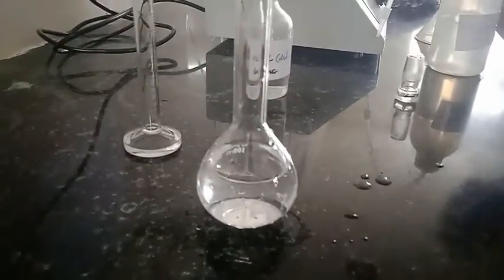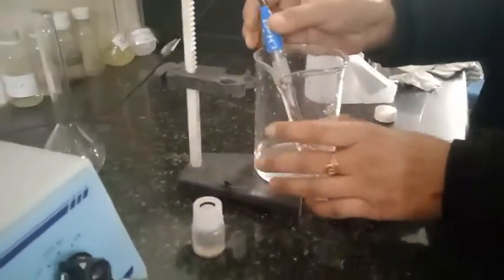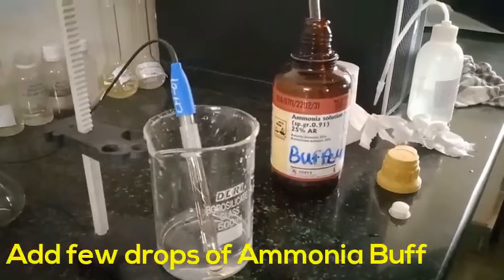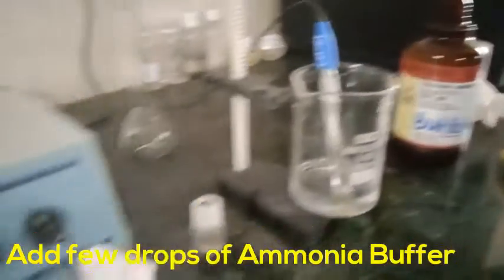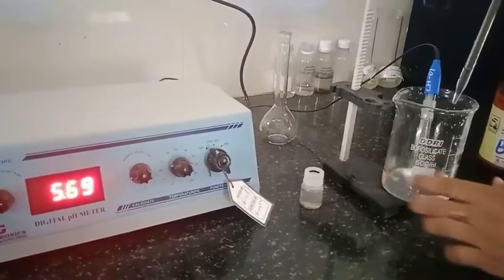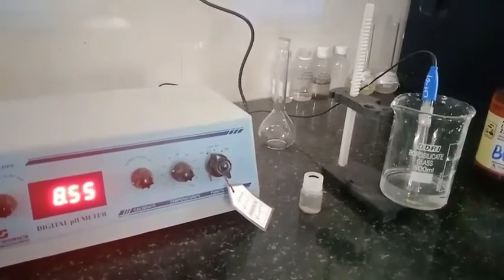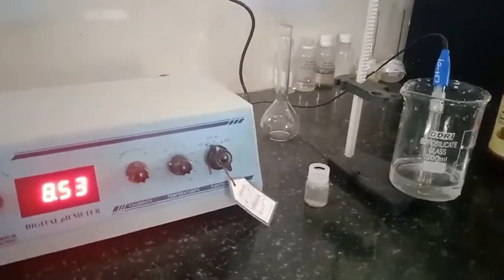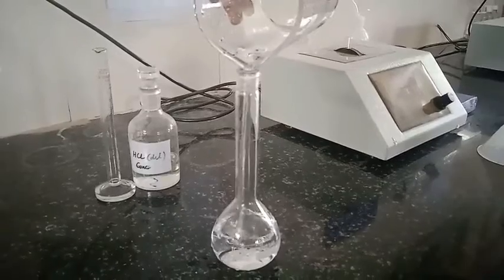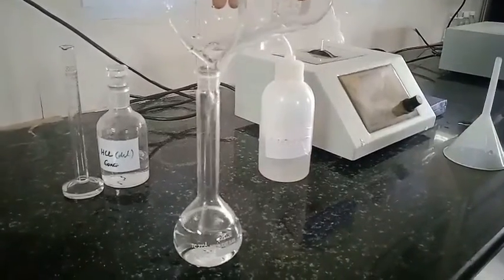Now make up the solution to about half volume, then transfer it into a beaker and measure the pH, because on adding HCl the pH goes down. To maintain the pH around neutral or in the basic range — since in EDTA titration we need a basic solution of calcium carbonate — adjust accordingly. Here you can see the pH increasing; now transfer it back into the measuring flask and make up to 100 mL to prepare the M/100 calcium carbonate solution.